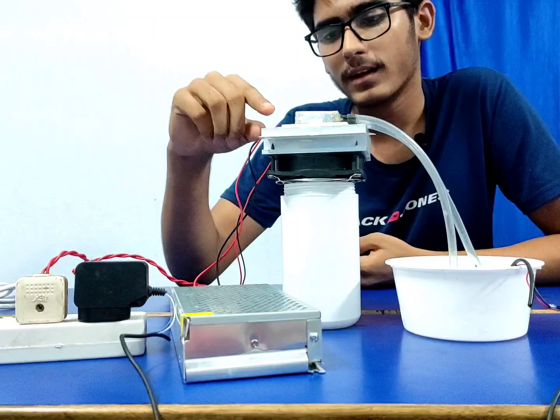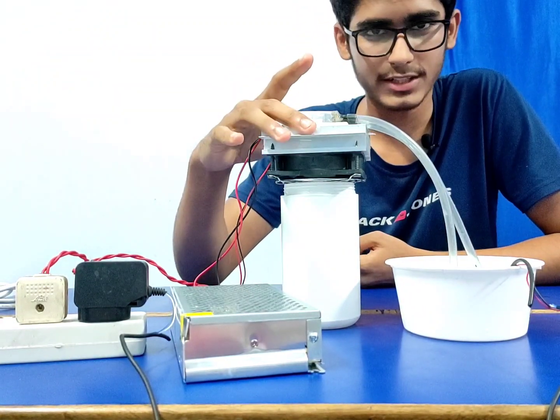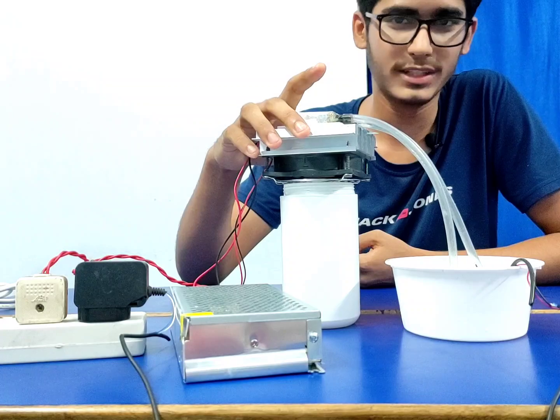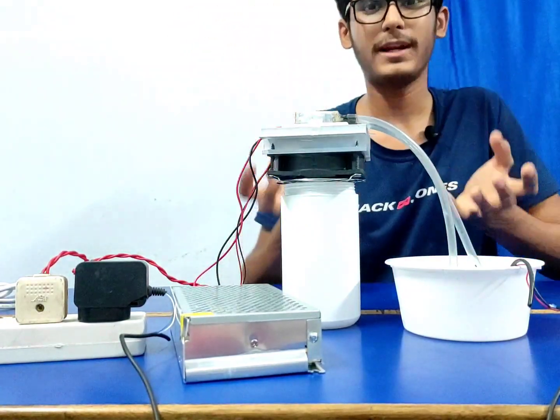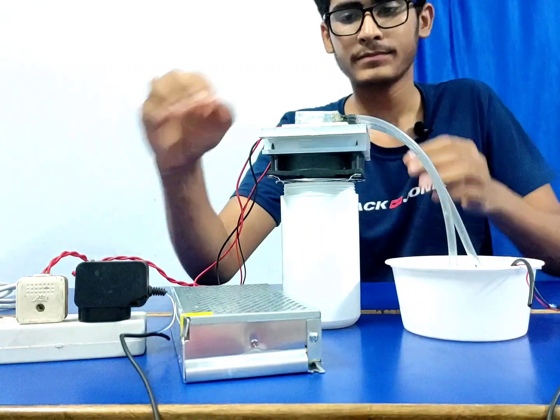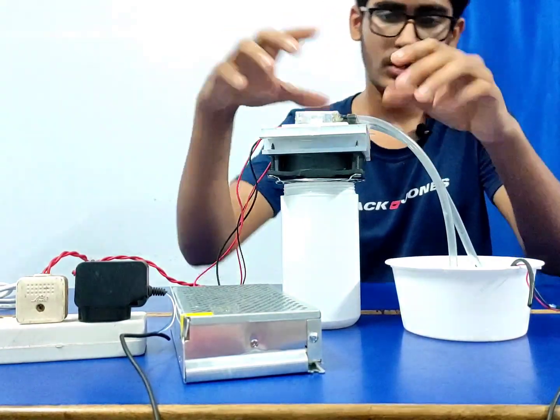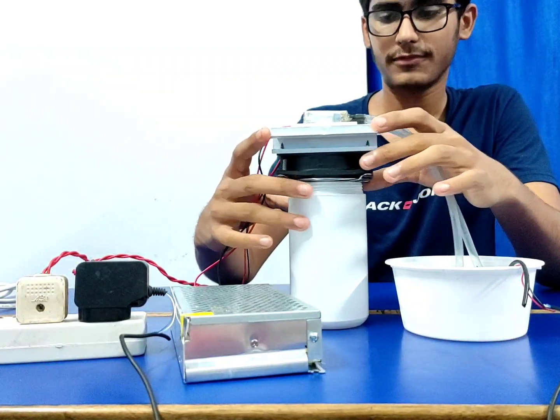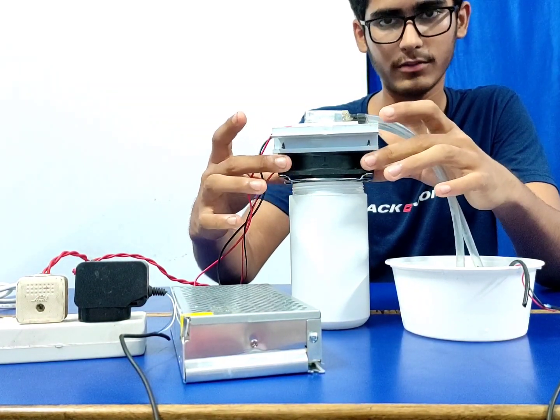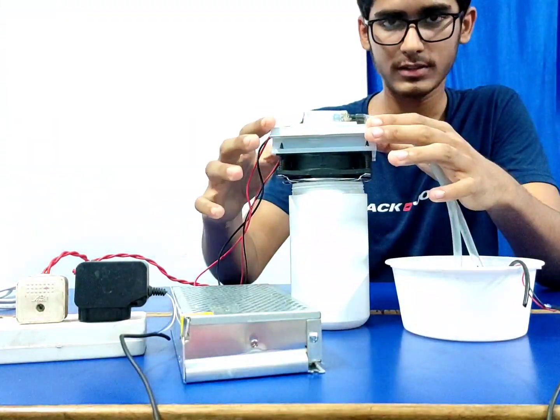So anyway, the hot side is placed with this big heat sink. This is called a heat sink. It's nothing, just a grill of aluminium. What it does is take the heat from the hot side of the Peltier module when we power it on, and it releases the heat in all directions through its grills. And also this fan, a small 12 volt DC fan, also used in computers, cools down this module.